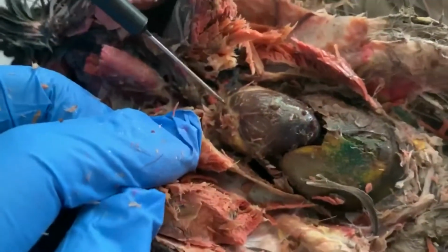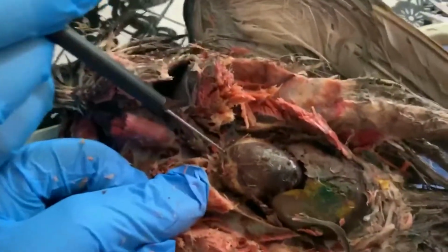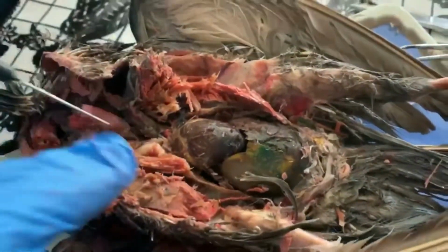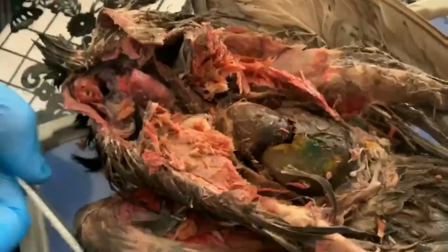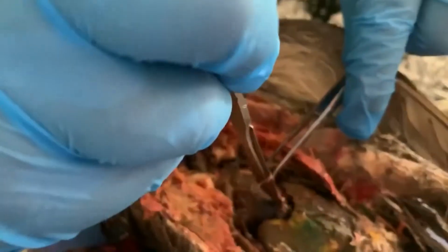So birds have incredibly large and elaborated hearts. Bird hearts are 4-chambered, just like our own. So we'll cut into it. Ava, if you want to work with a scalpel and go from the bottom to the top of it, the scalpel's right here. You'll see that we have a left and right atrium and a left and right ventricle.